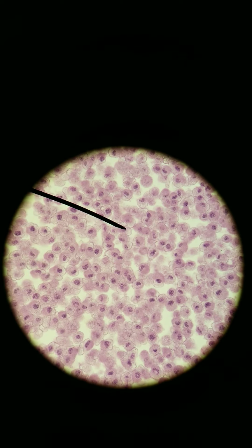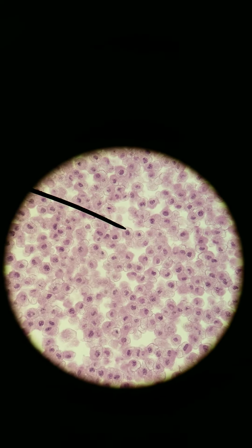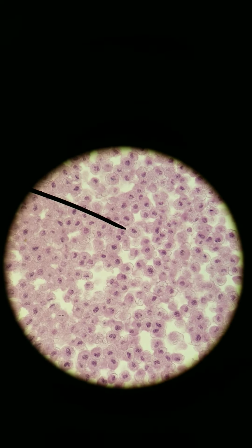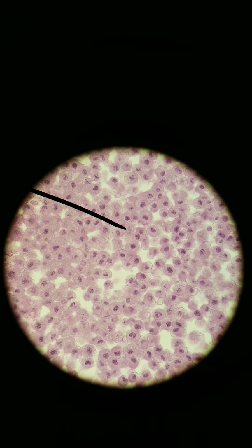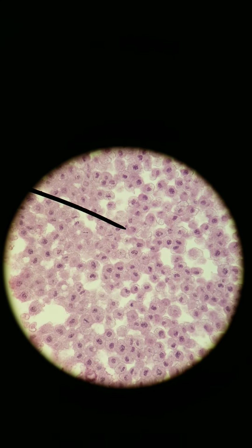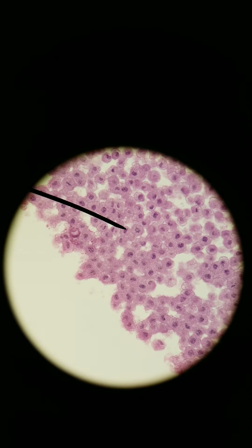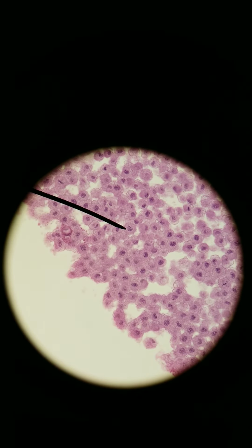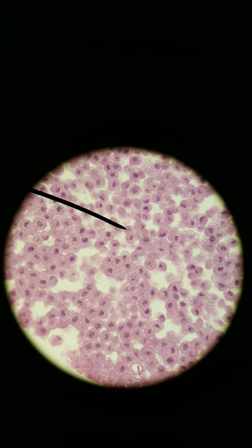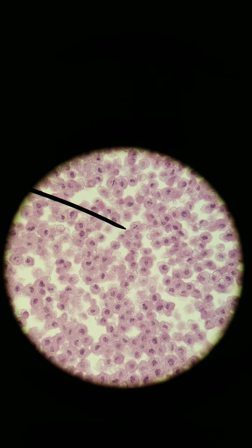I am looking. If I had Jeopardy music, I would play it right now. I see one in metaphase, another in metaphase, more metaphase and interphase. Ooh, here's a really good one in prophase. Right there. The one I'm pointing out, that's a really good one in prophase. Above the arrow is metaphase. Lots of metaphase.